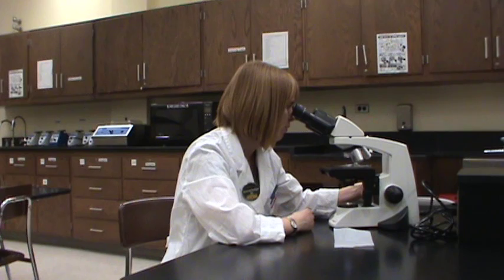I've got my slide on there. I'm going to maneuver my slide to where I saw that film when I looked at it in the light. I'm going to lower the light because I can tell just by briefly looking through the ocular lens that the light is very intense — I don't want to be seeing stars when I look through the microscope. Then I'm going to spread the ocular lenses a little bit so that I can use both eyes. I'm going to look through the microscope, take the coarse focus, and slowly crank the stage down to wait and see if anything comes into focus.